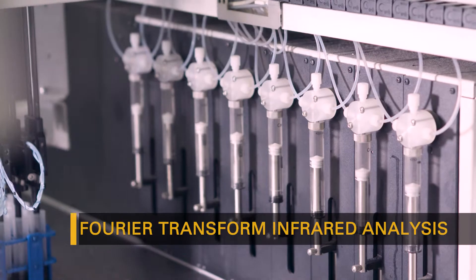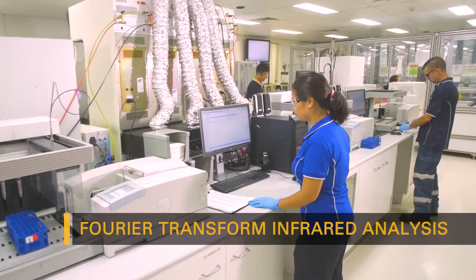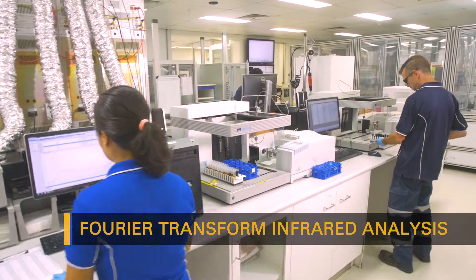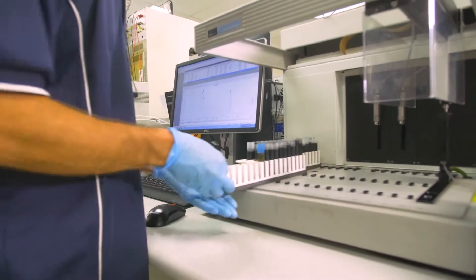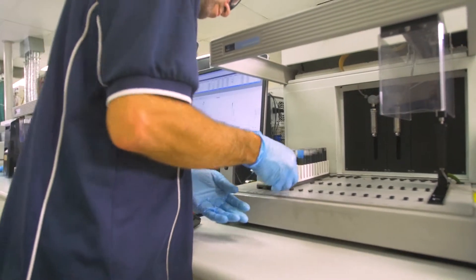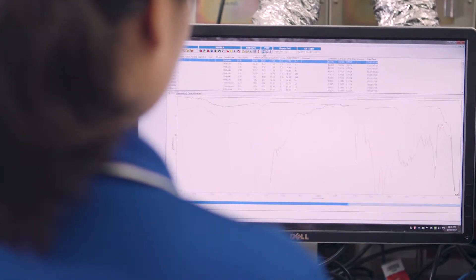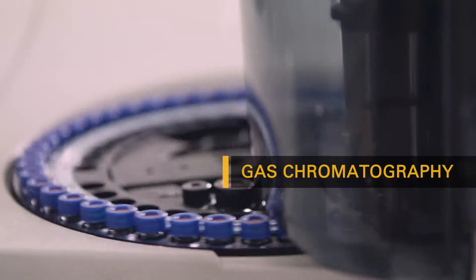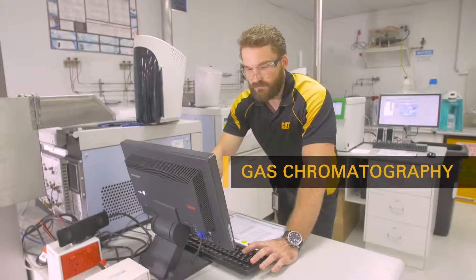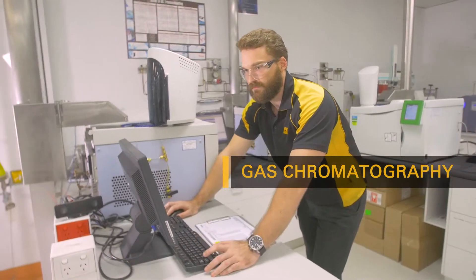Fourier transform infrared analysis is completed to determine the degree of oil deterioration. This testing identifies soot, oxidation, nitration, and sulfur products. As fuel mixes with the oil, it reduces the overall viscosity, compromising the oil's ability to maintain an adequate film thickness.